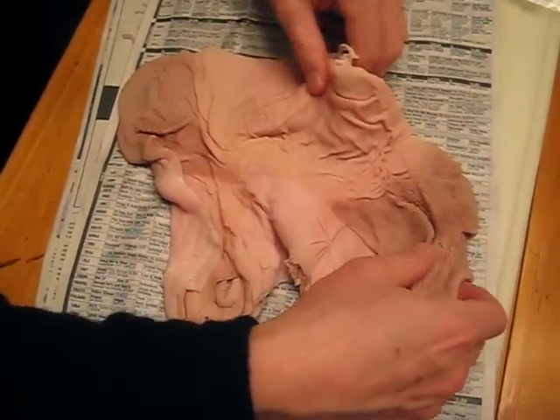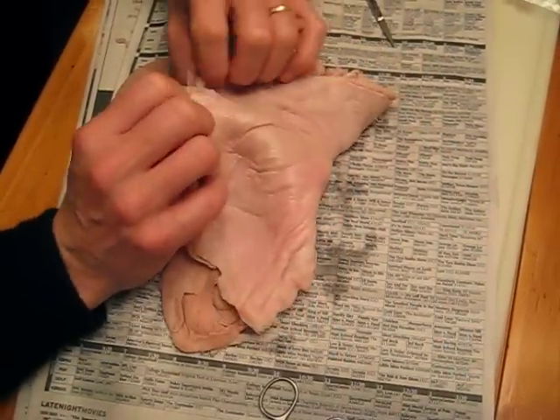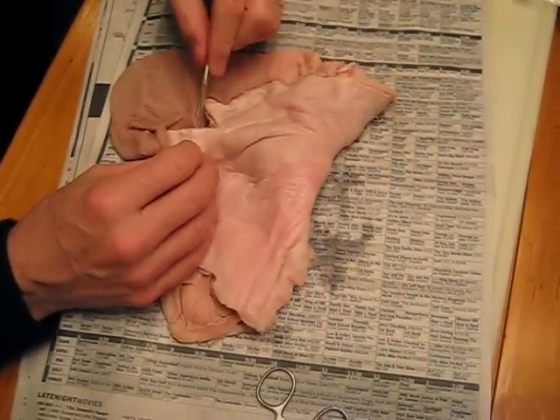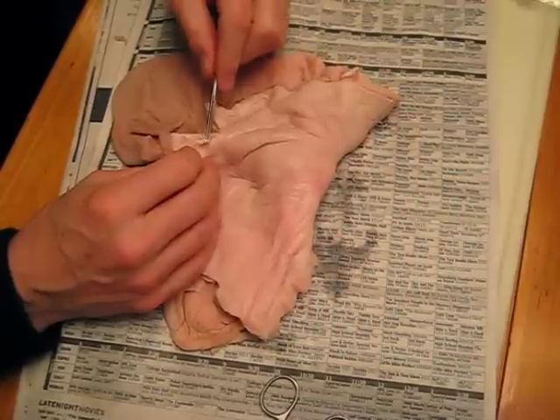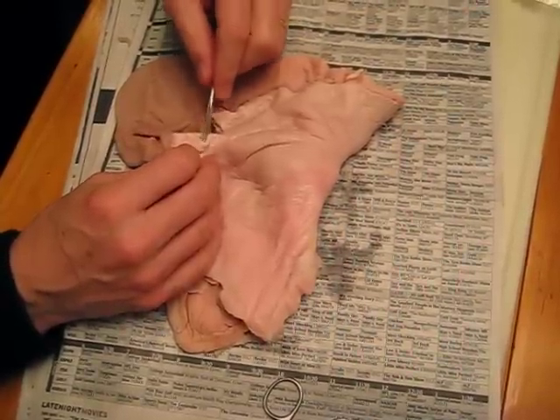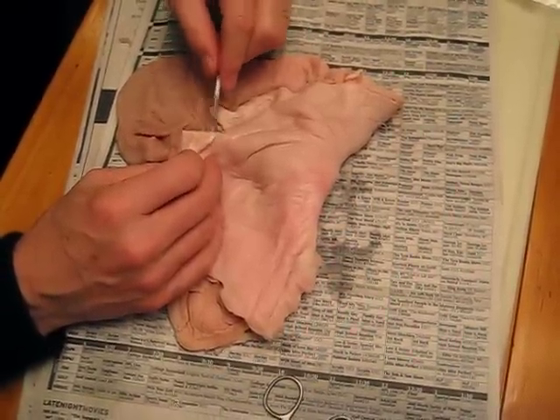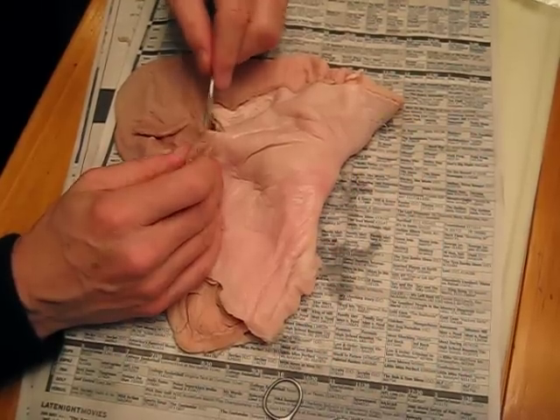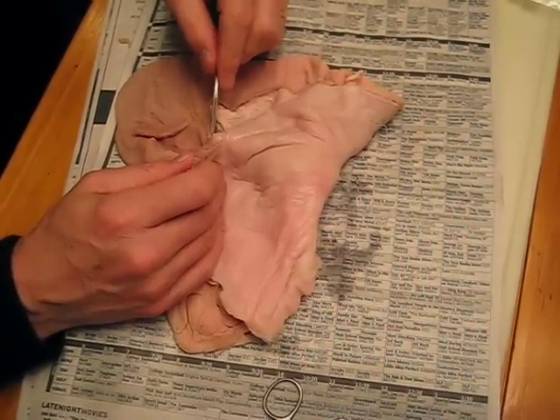They're going to love to see that smooth muscle. Now, if you really want to see smooth muscle, here's what lines on the outside: that's peritoneum, smooth muscle right there, and then gastric mucosa where the acid gets made.